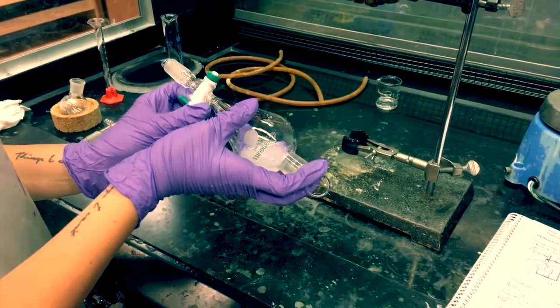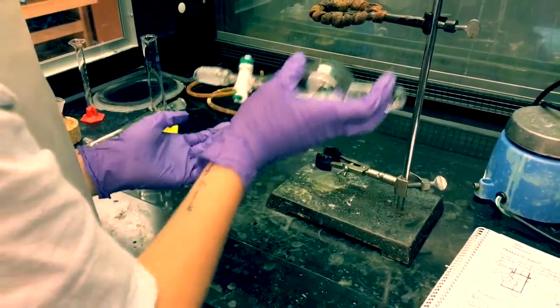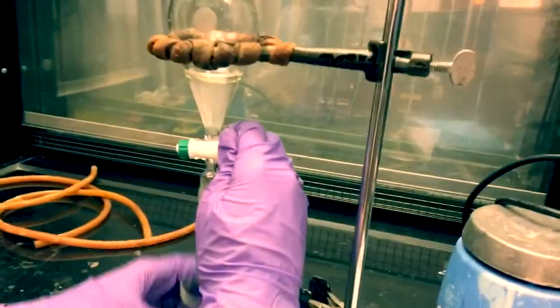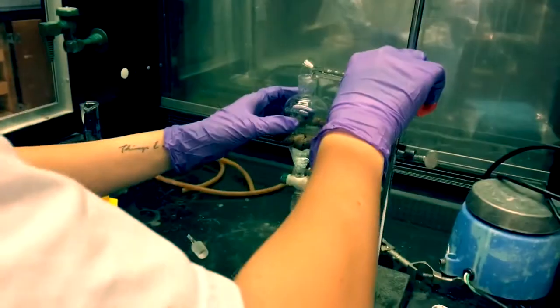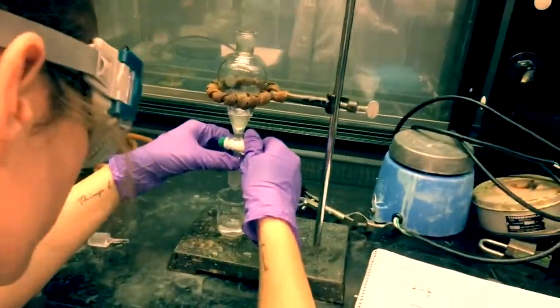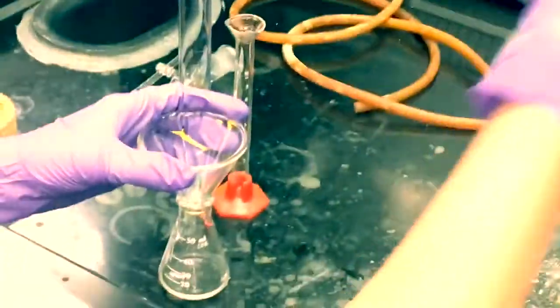Then, begin to shake the mixture and allow the layers to separate. After that, draw off the aqueous layer, which should be at the bottom, and wash the remaining styrene with two 4 mL portions of water sequentially. Then, transfer the styrene into a small Erlenmeyer flask and proceed to dry it with a small amount of calcium chloride.